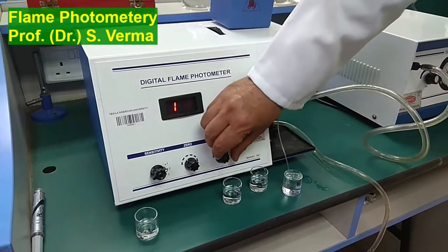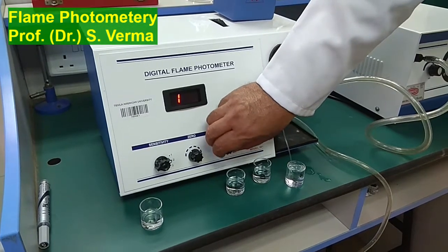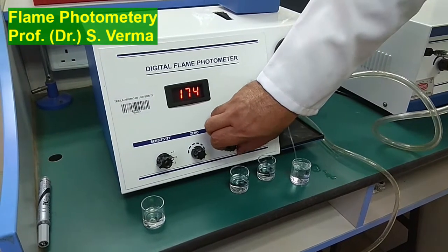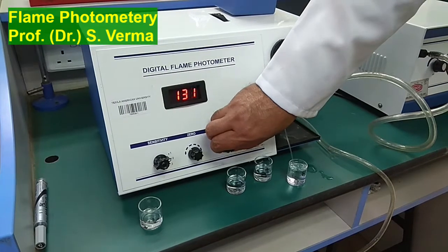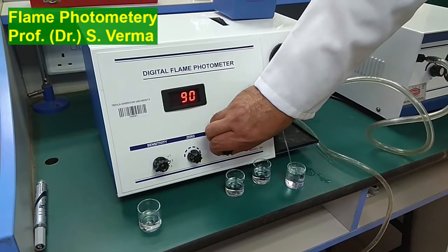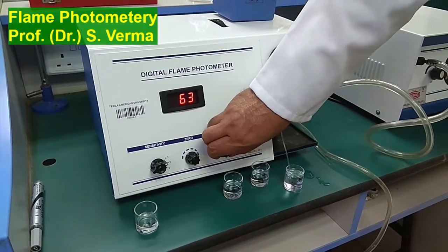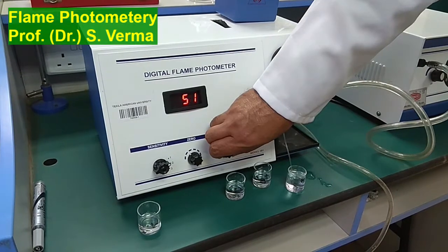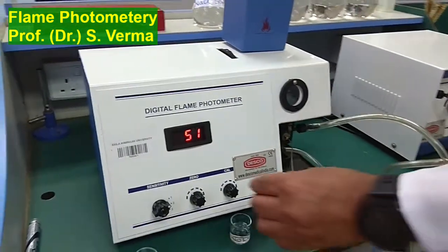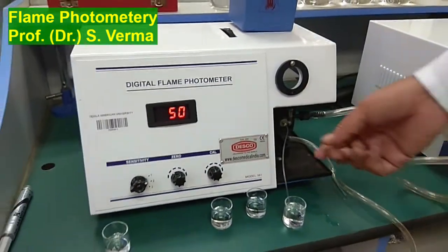So I have to adjust it to 50 by rotating this knob here. So the instrument is adjusted to 50.